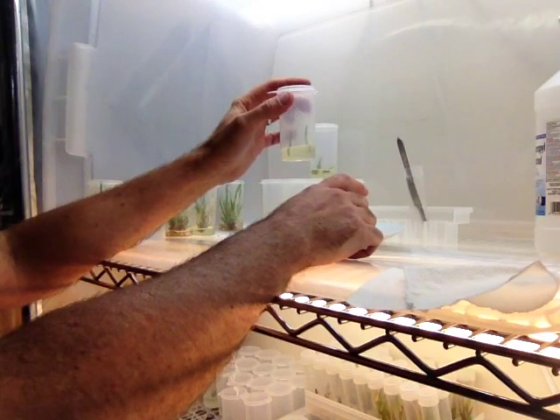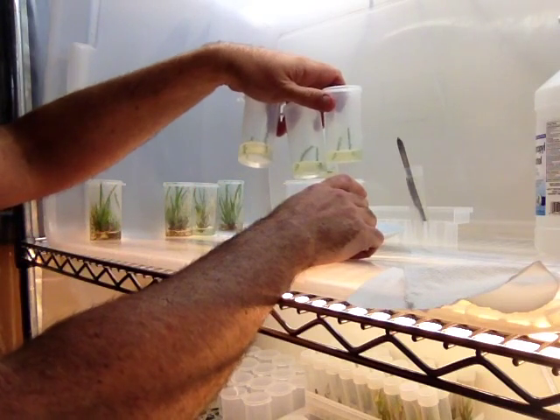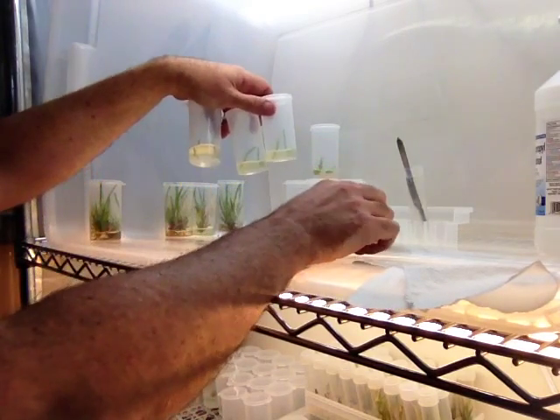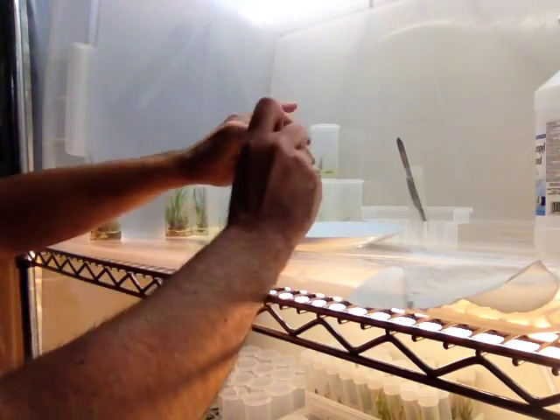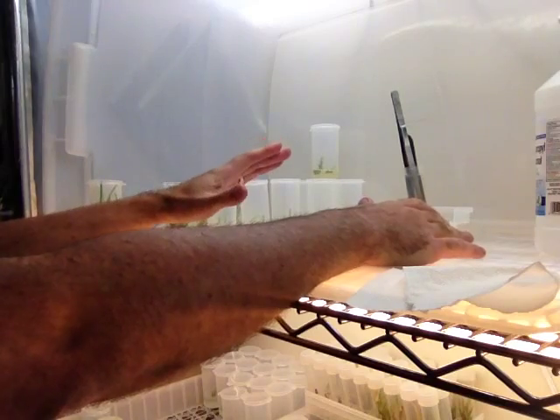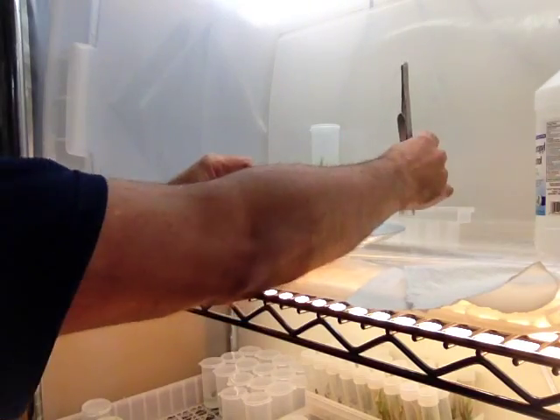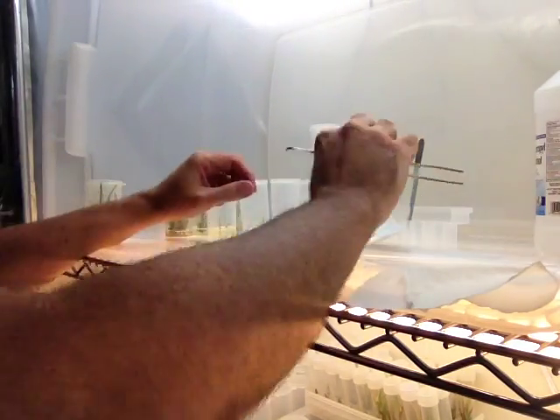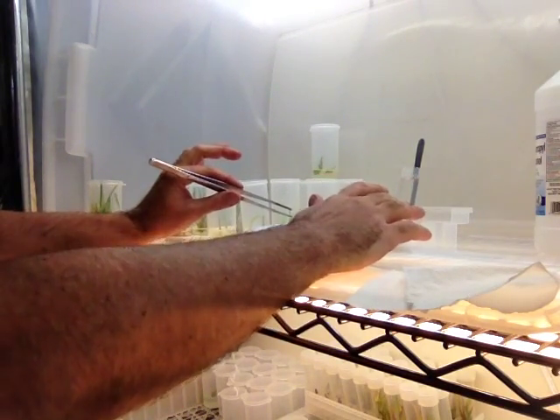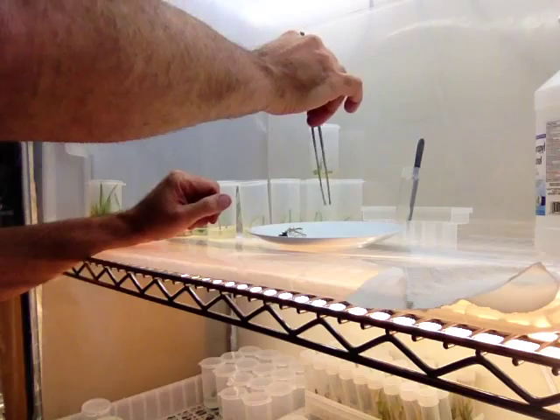If this was pink rooting media, this would be rooting tissue culture. I'd probably have done all of these as rooting because I know I can get this many new plants from just one bottle like that. The tool goes back in. The other thing I didn't do here was reach over the plate to get my tools. When I needed something from the alcohol — this is a tube of alcohol with the tools in it — I pick it up with my right hand and hand it to myself. I don't want to lean over the plate at all. I keep my hands flat on the table so I'm not actually leaning over anything.